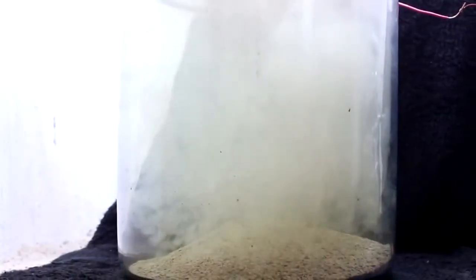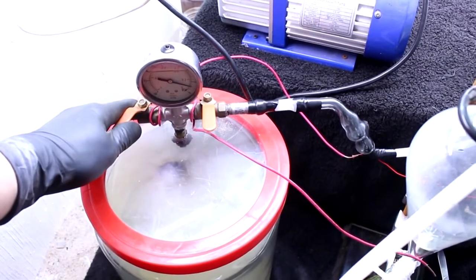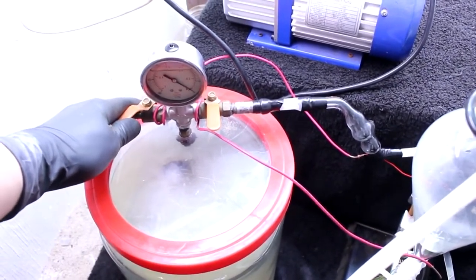Let's see if we can light the candle. I'm going to turn on the electricity now. The candle did not light. I think I burned out my wire. My guess is there's just not enough chlorine to sustain combustion.